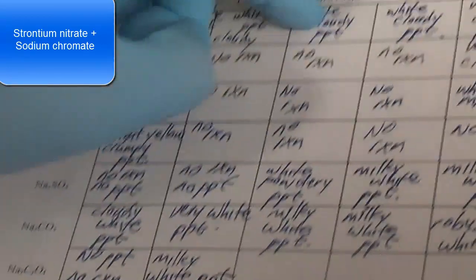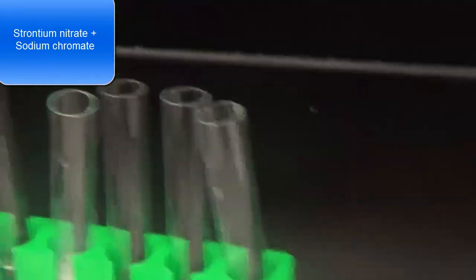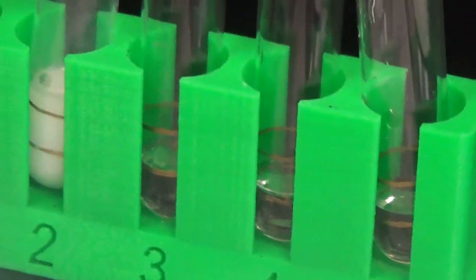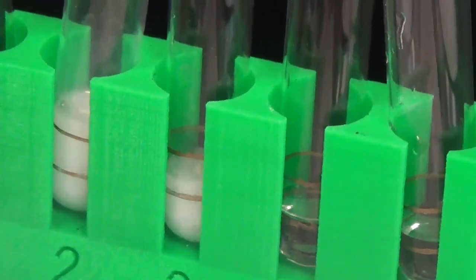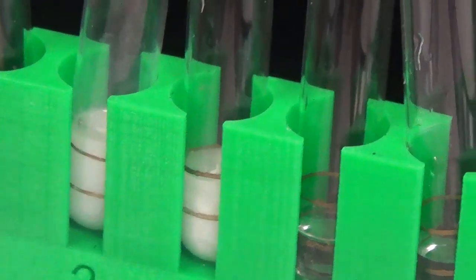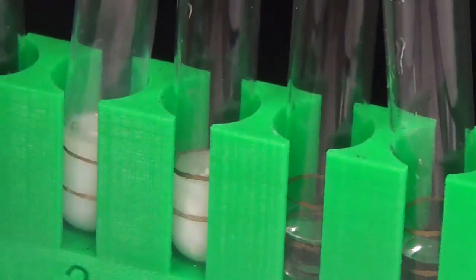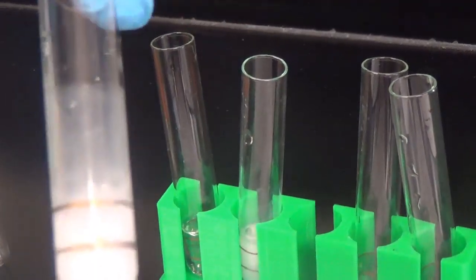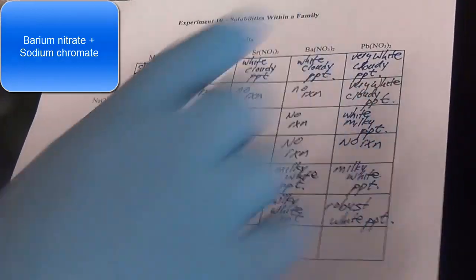All right, chromate and strontium nitrate. Okay, another big precipitate. These things do not want to stay in water, it appears to me. Another milky white precipitate. Sodium chromate, barium nitrate.